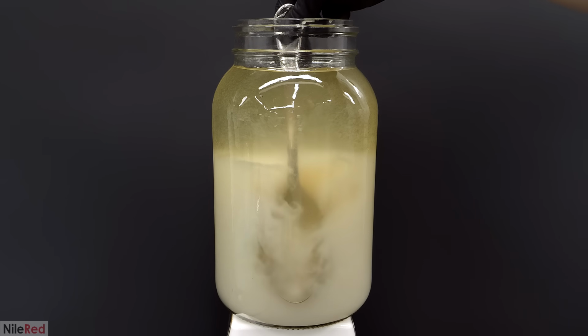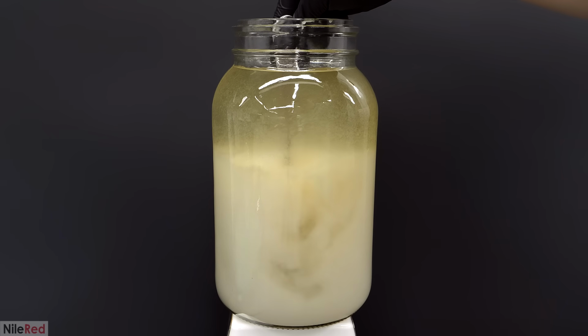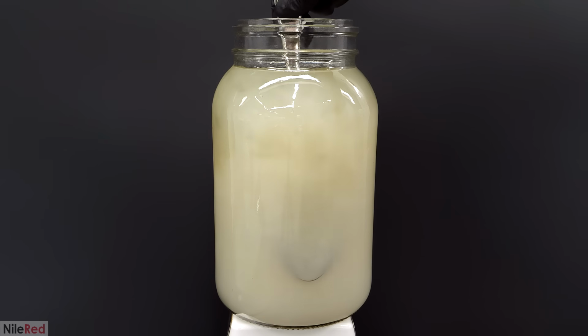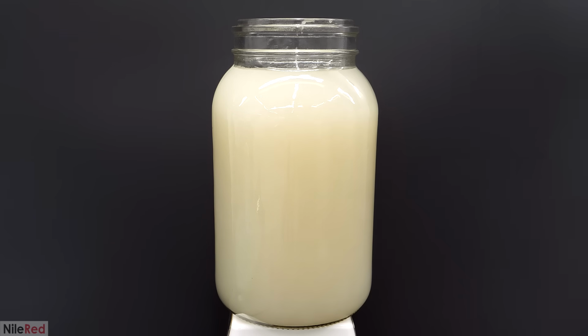I was honestly really impressed with how fine and fluffy it was, and like I said before, I really didn't expect it to work this well. I'm really not sure exactly how much paper was still left here, but I feel like it was probably around 10 to 20% of what I started with. However, that's almost just entirely speculation on my part, and not really based on much.